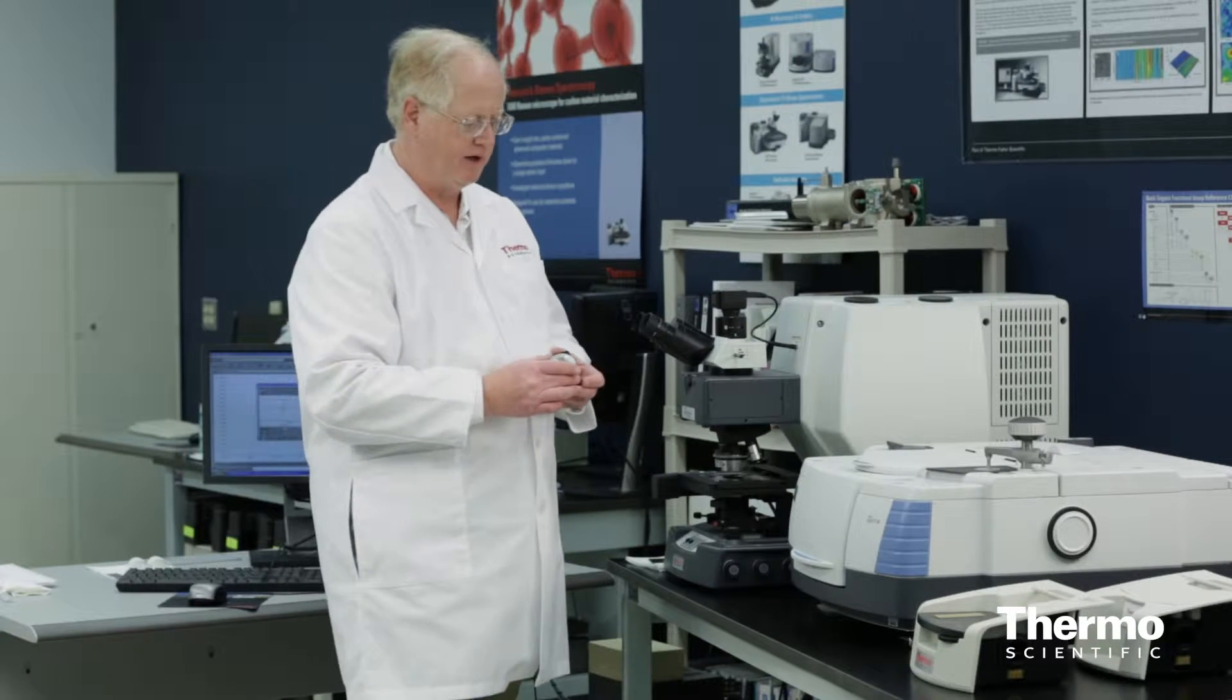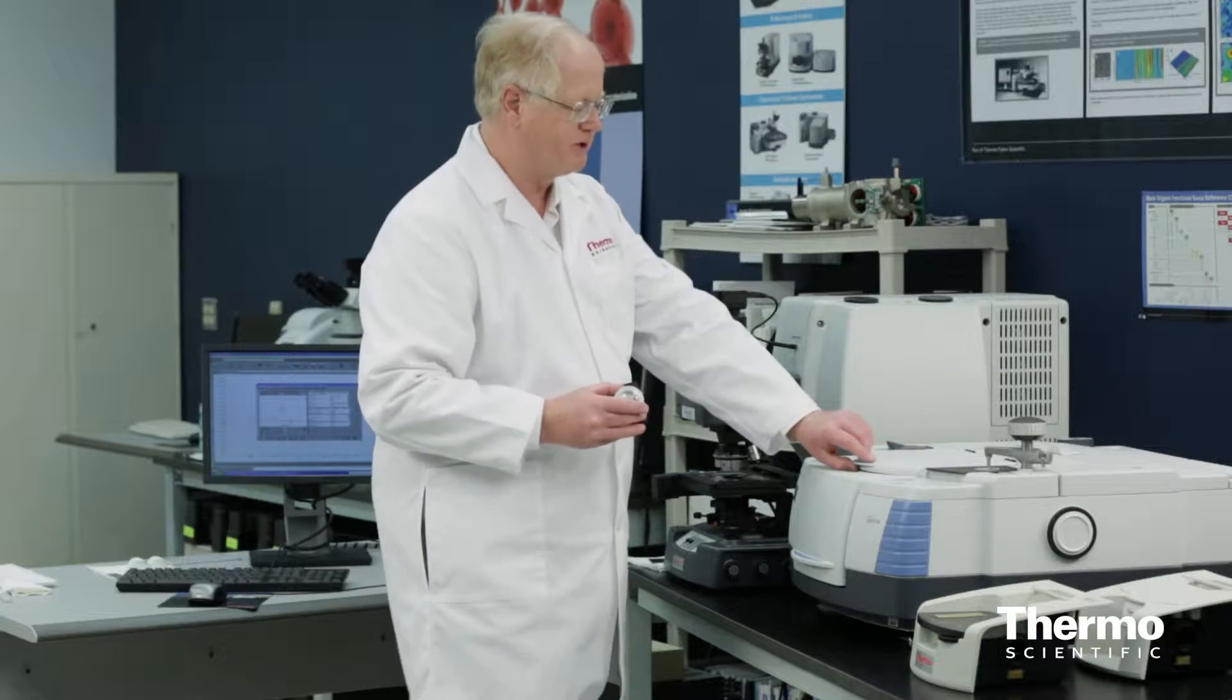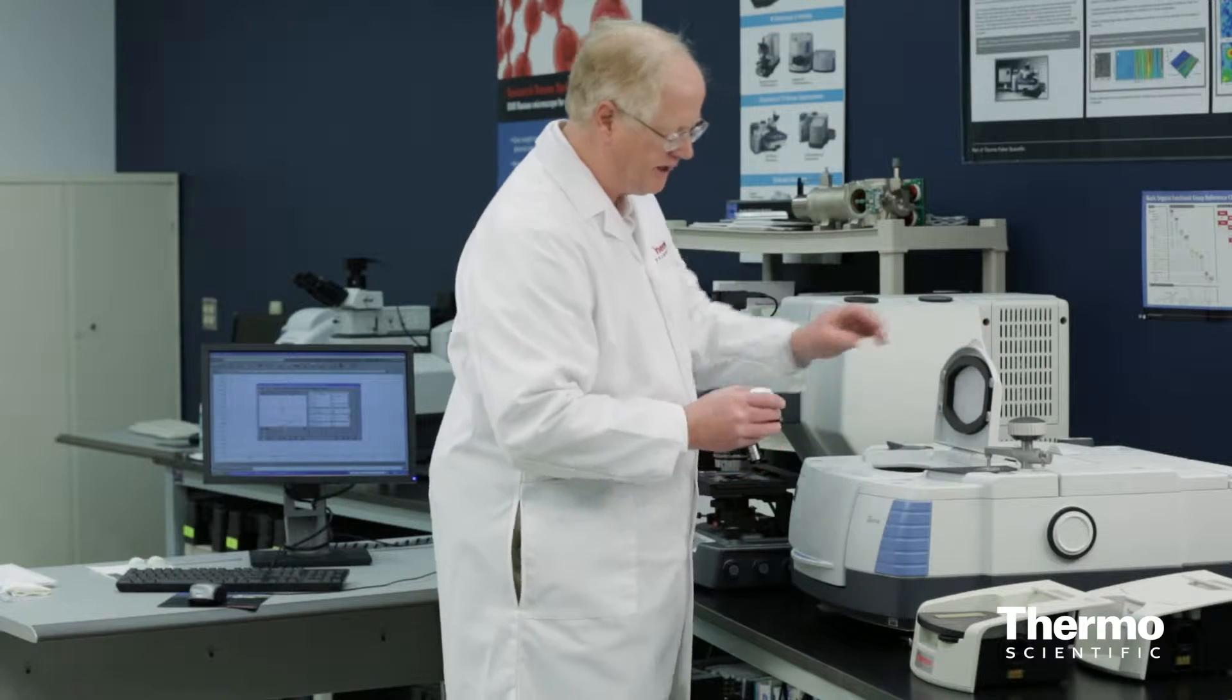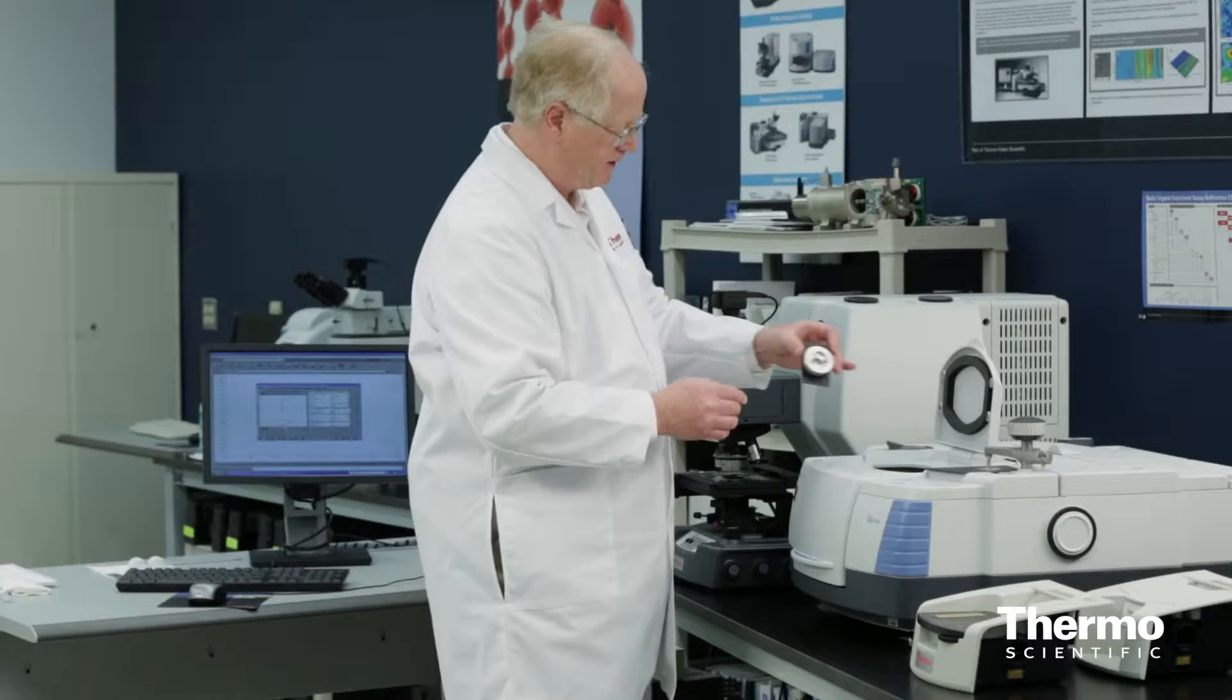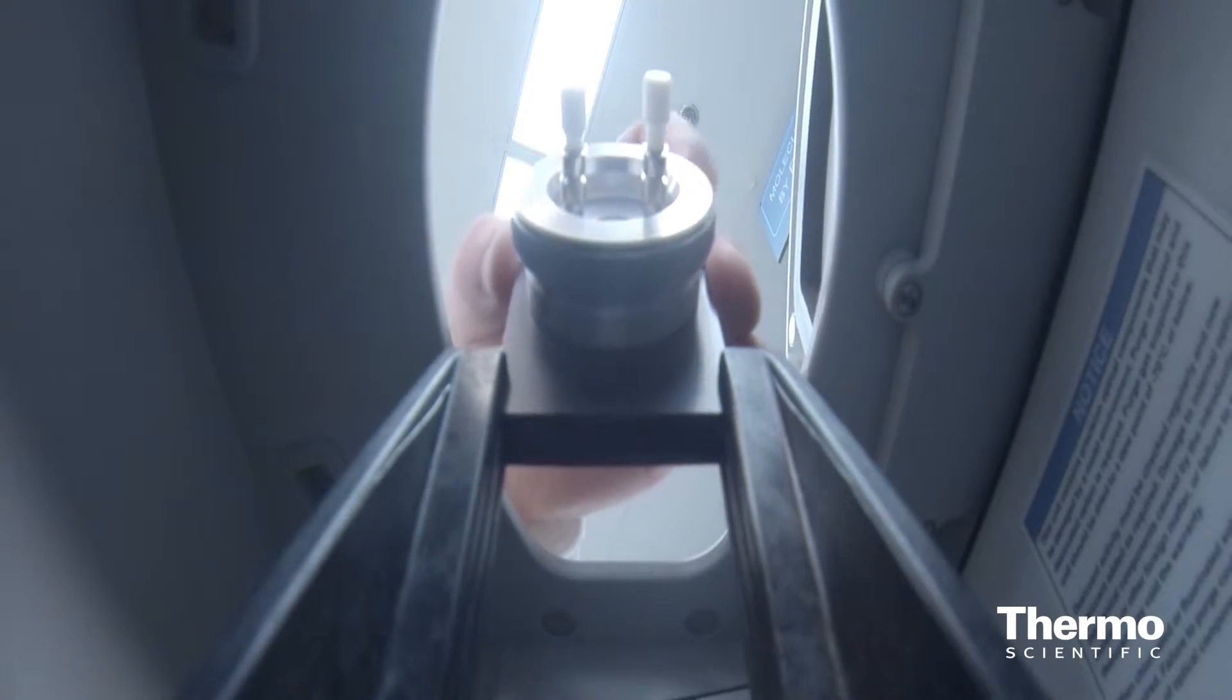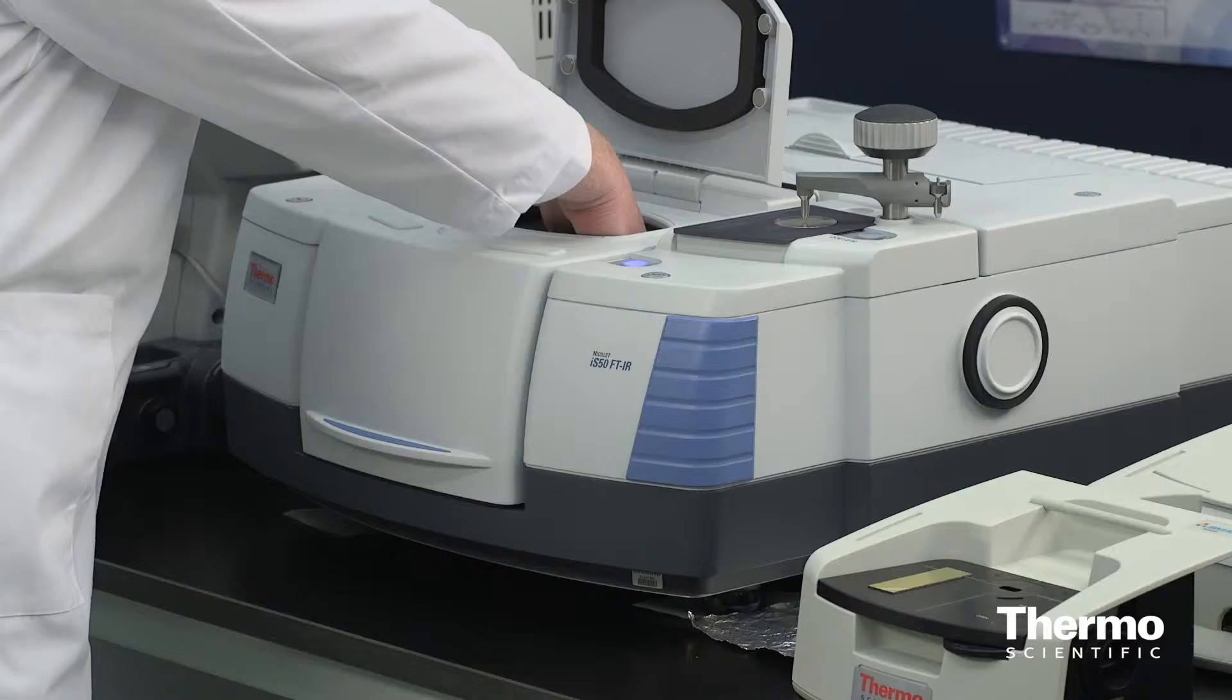To mount this into the Thermo Scientific Nicolet IS-50 FTIR is quite simple. There is a slotted holder right in here that this slides right into, just like a card into a slot, and it slides right down.